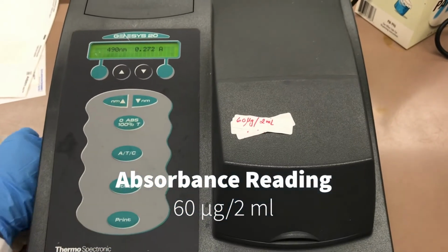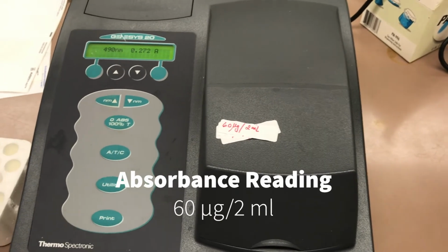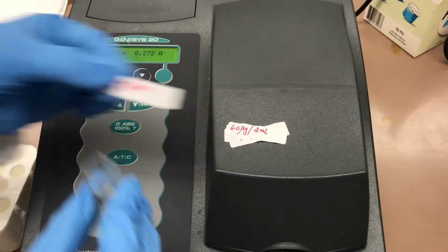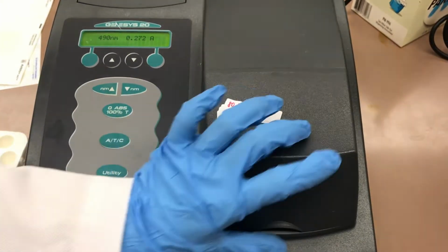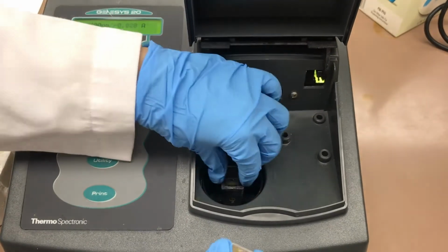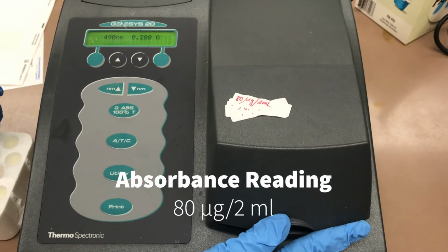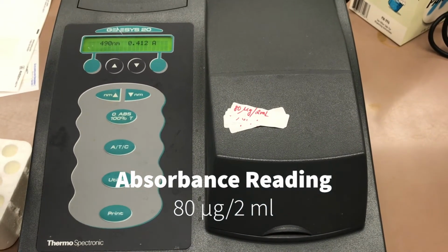This is the absorbance reading for 60 micrograms of glucose per 2 milliliters. This is the absorbance reading for 80 micrograms of glucose per 2 milliliters.